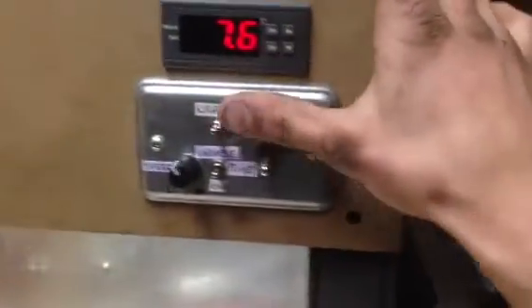The chiller unit is working perfectly. The switch for the water is all wired in. The switch for the lights is wired in.